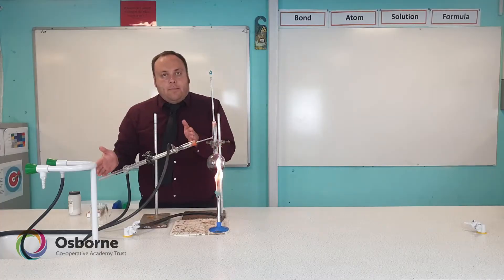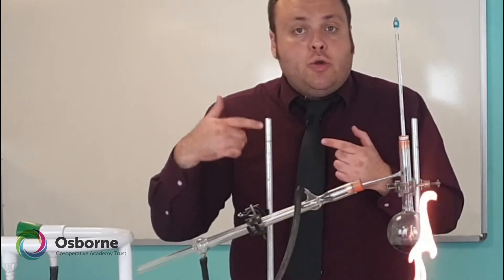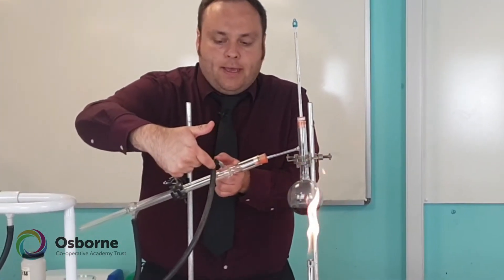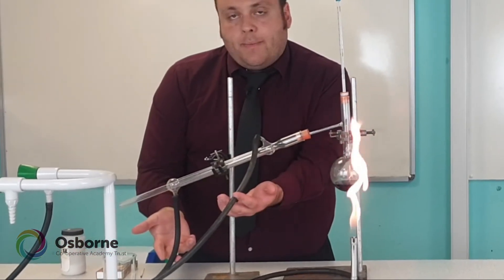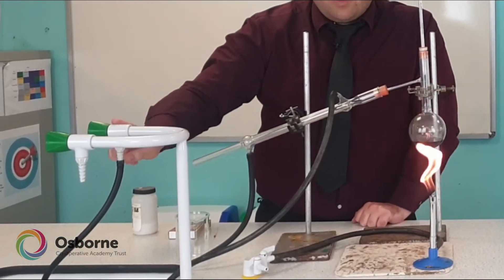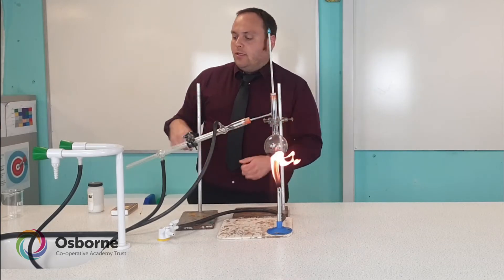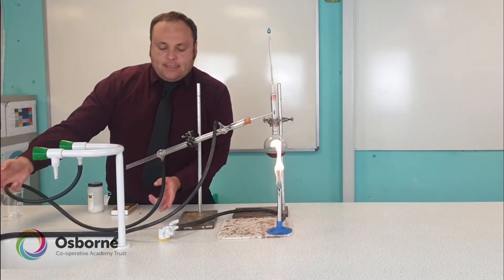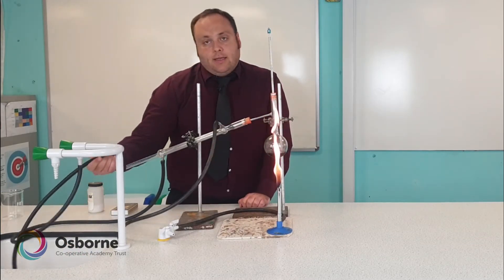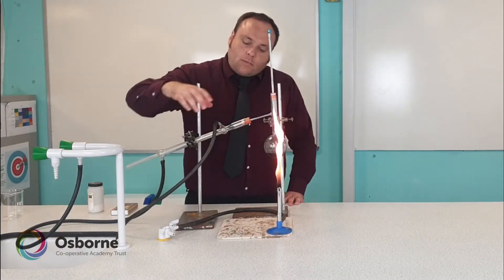Further along the sidearm is a piece of equipment called the condenser — this type is called a Liebig condenser and it's basically a tube within a tube. The inner tube is where the steam will come in from the top. The outer tube has rubber connections connected to the cold water tap, and when switched on we essentially have a jacket of cold water going around the inner tube.